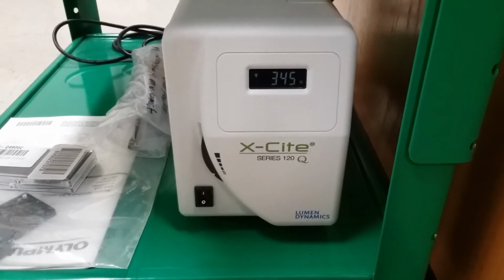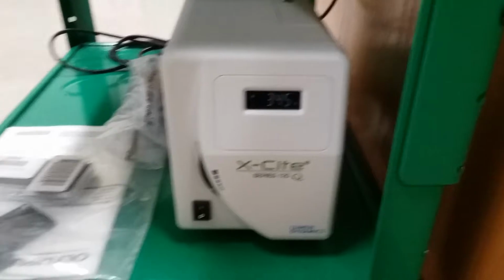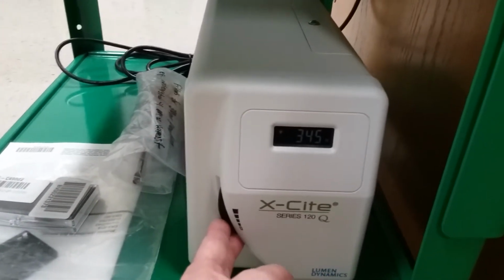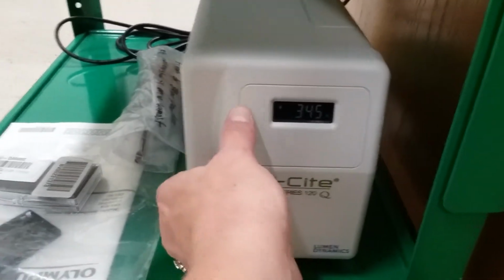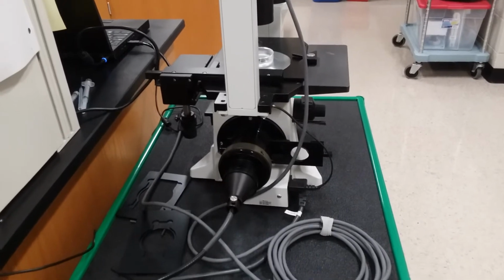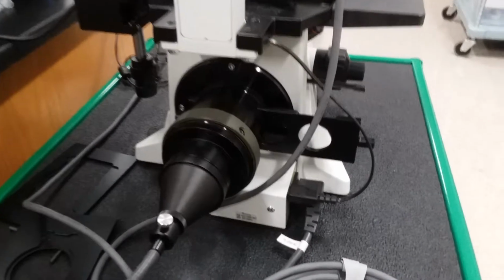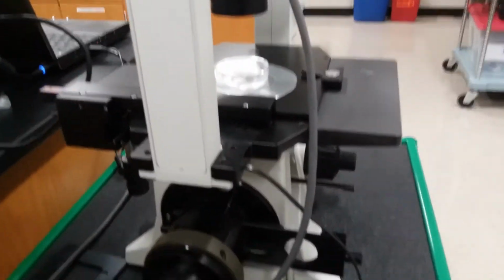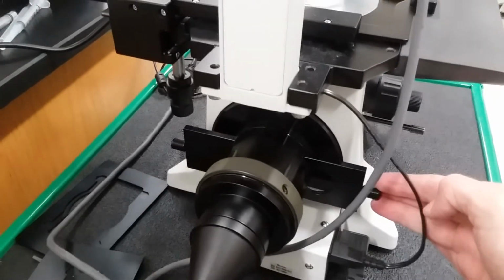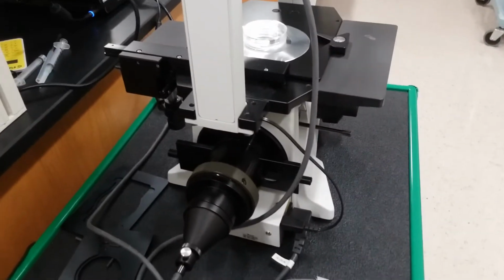All fluorescent microscopes have something in common. They have a source for ultraviolet light to come to the microscope. So my next step would be to turn on my UV light box and increase my intensity of the light coming through. And so this is the back of the scope, and we can see this optic wire coming through, letting the UV light come to the microscope. So our next step is to let the UV light in by moving this panel so the blank spot is open and lets the light in.